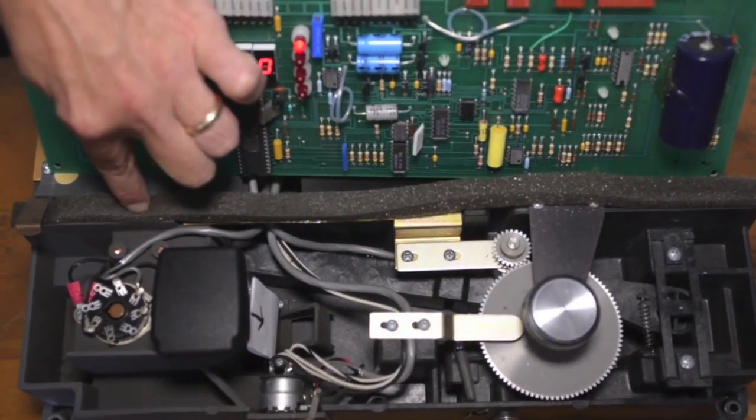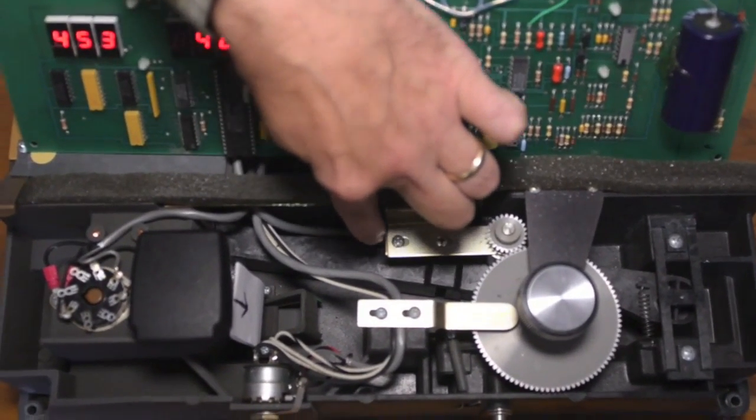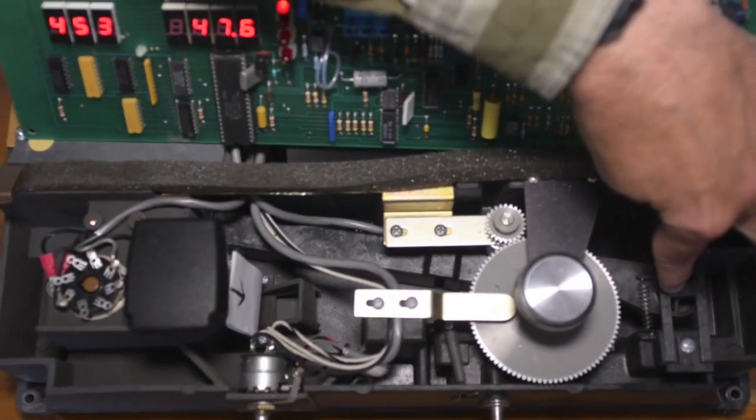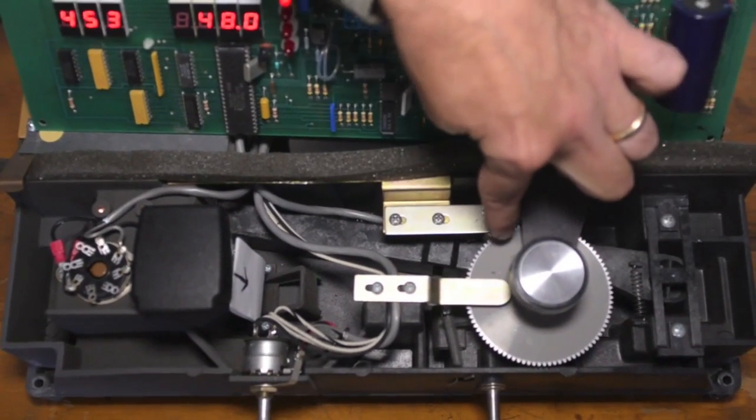Any of the light that comes from the lamp is then channeled into this light tunnel, and the purpose of the light tunnel is just to capture all the light and to focus it down to the grating, which sits right under here. Remember that the grating will break the light into various wavelengths and then bounce it in the direction the wavelength came.